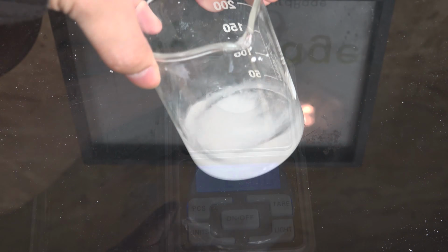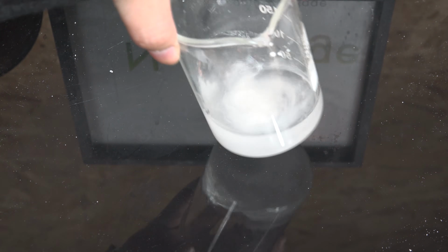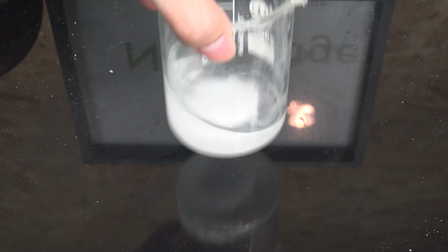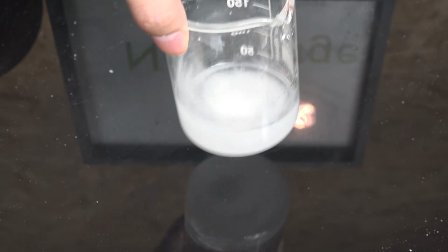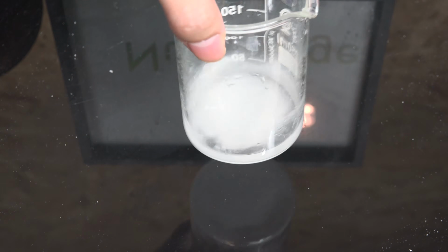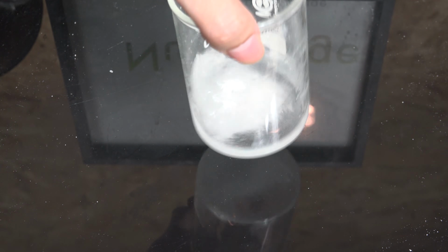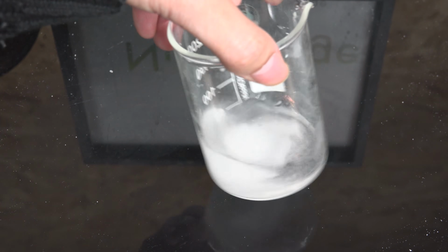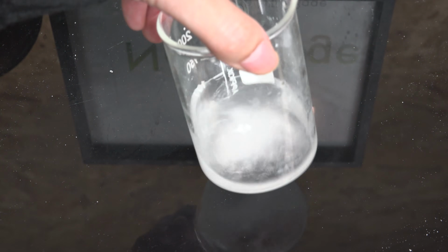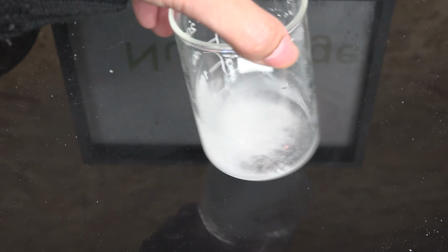Could you use a highly soluble solvent for the powder and just make it low solubility with saturation? You can, but the error will get bigger because at high solubilities, the solubility also tends to be more variable with things like temperature or ionic strength. Evaporation will also leave behind more solid and cause more errors. So it might not saturate exactly the same way as you run the measurement. For small solubilities, a 1% change is nothing, but for high solubility, a 1% change can be significant.